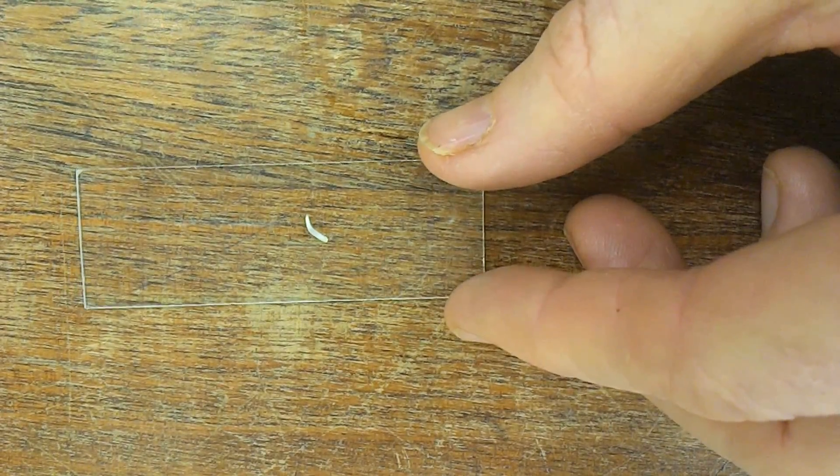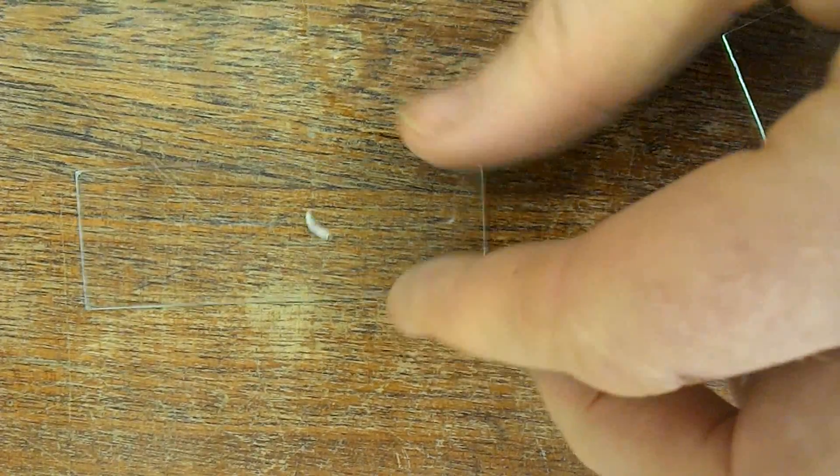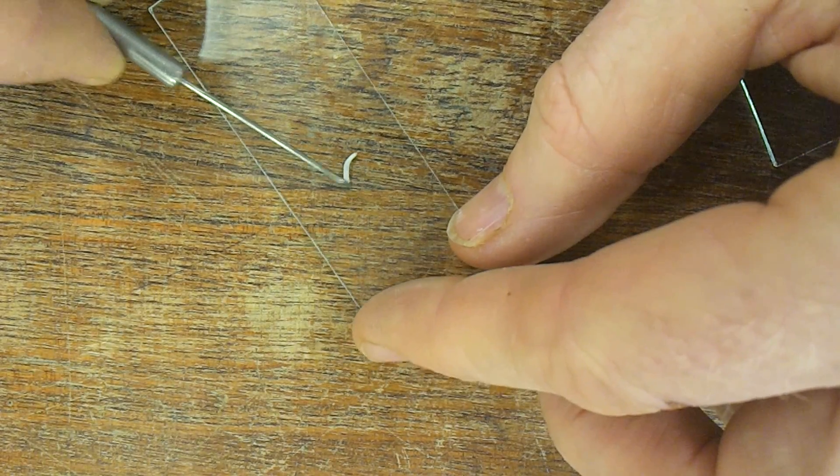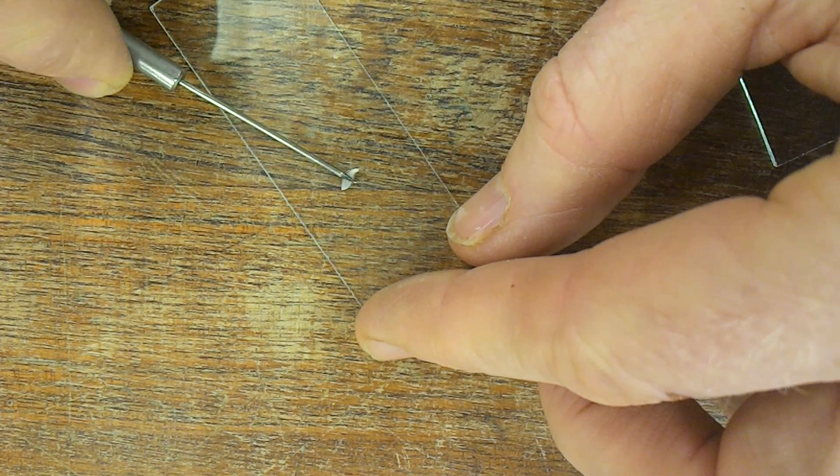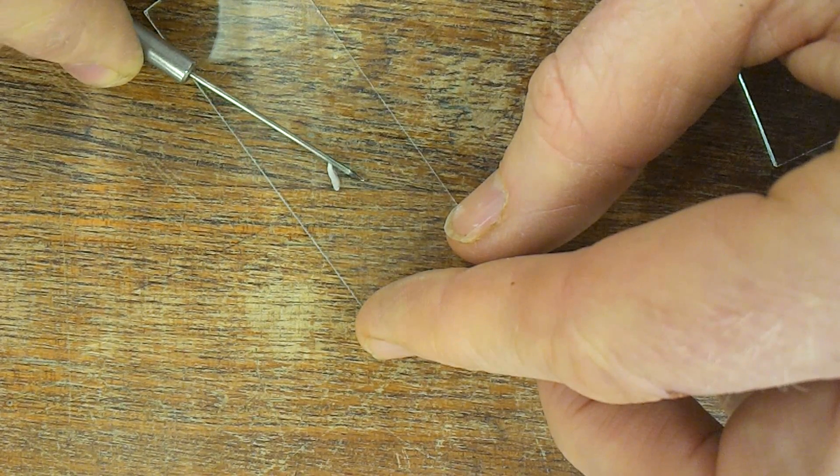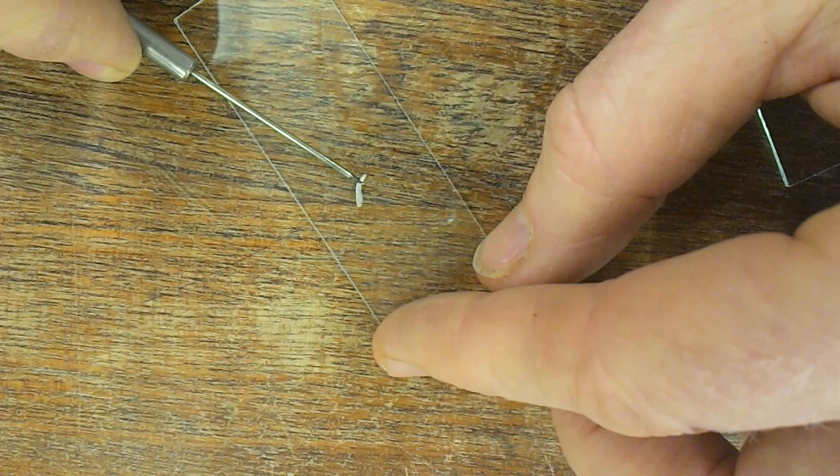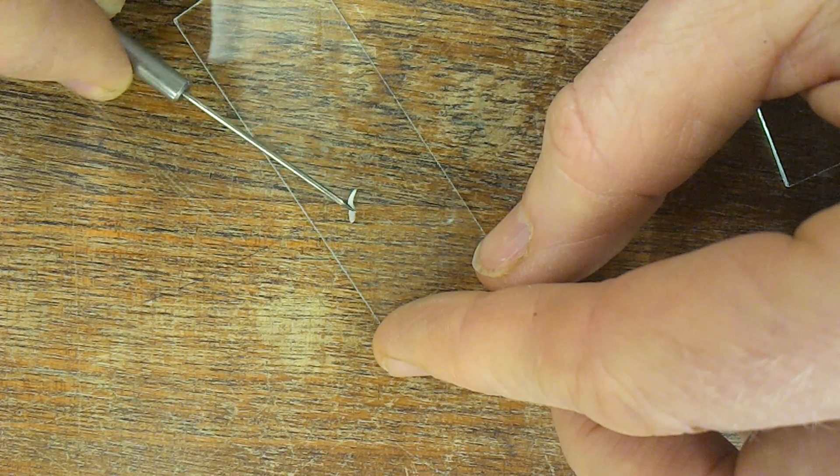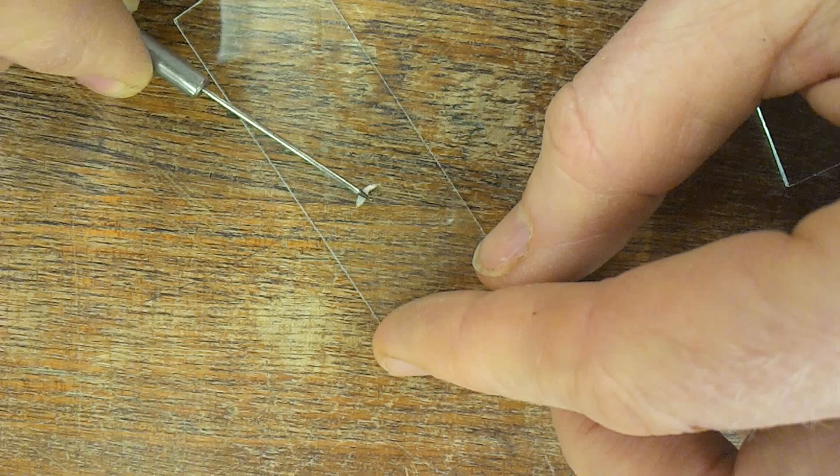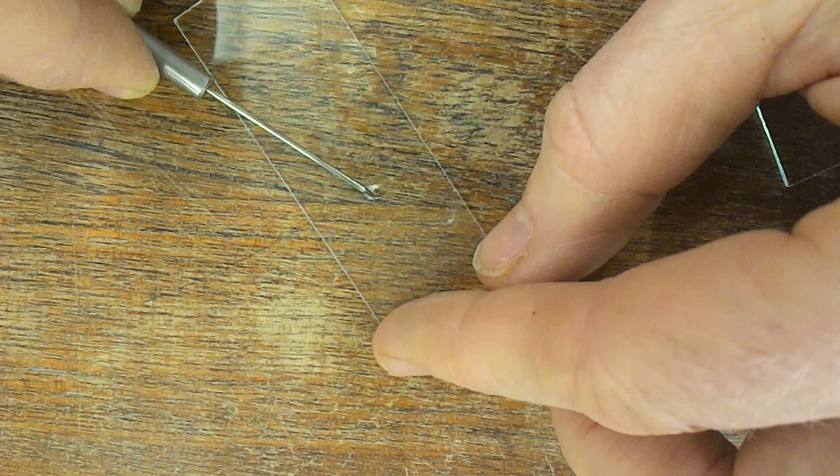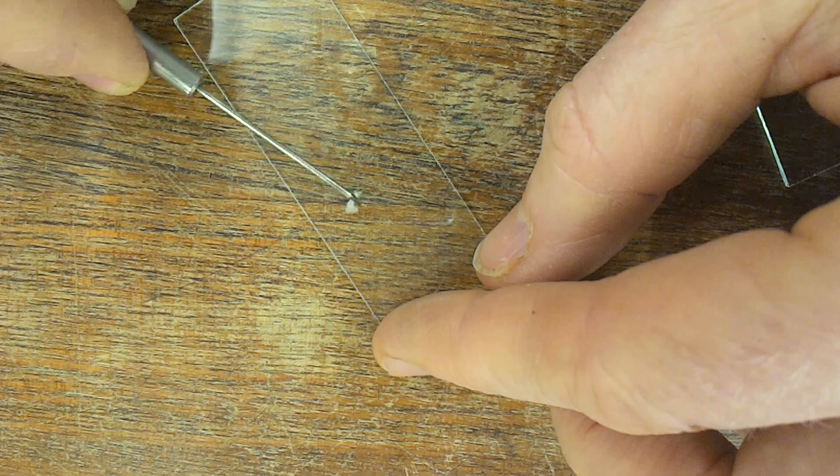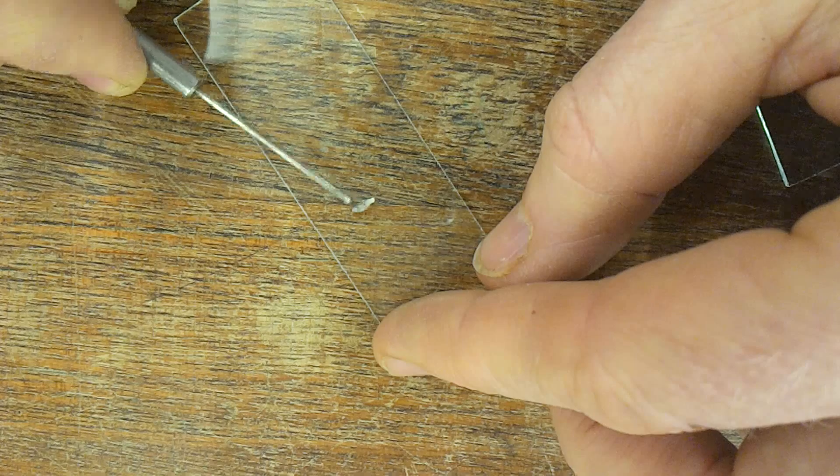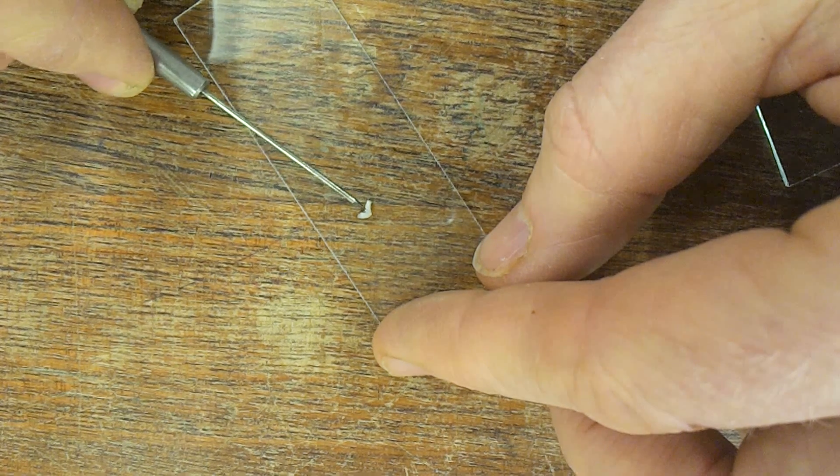We're going to squash it with a mounted needle, breaking the cells open a bit. You should find it's quite soft now because the hydrochloric acid will have broken the cell walls. You're just squashing it with the mounted needle.